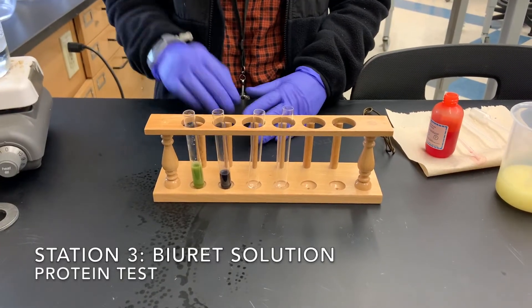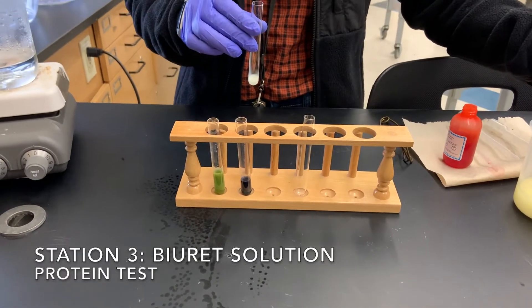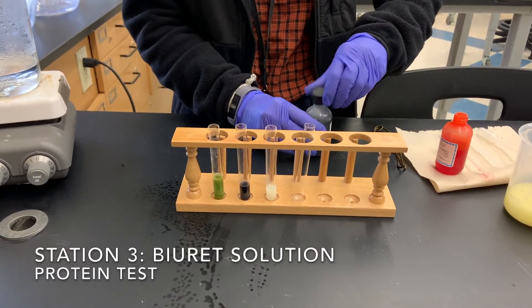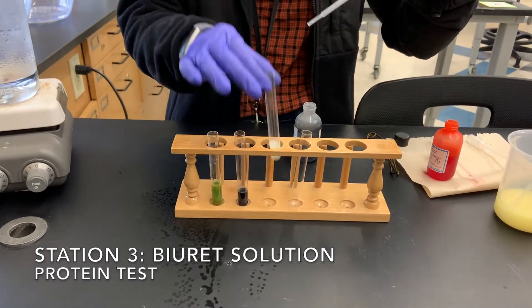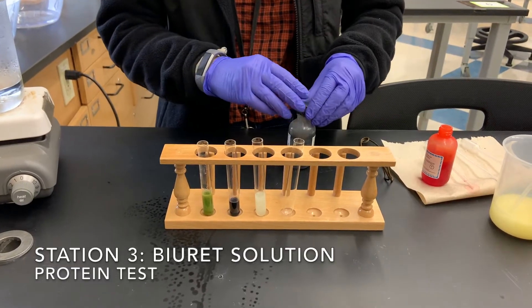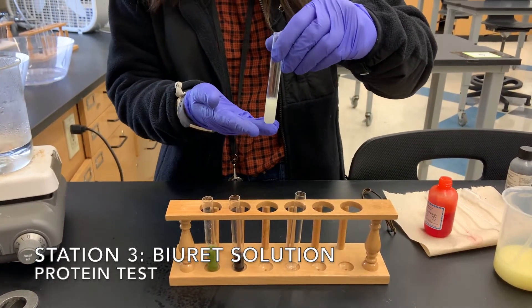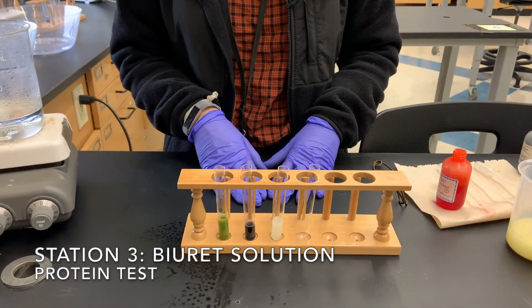Next, we're going to do our protein test. In order to test for proteins, we add our victim's stomach contents into the test tube — two milliliters — and to that we are going to add one milliliter of biuret solution. You can see our solution is still basically the same color as the stomach contents of the victim. There was no change.